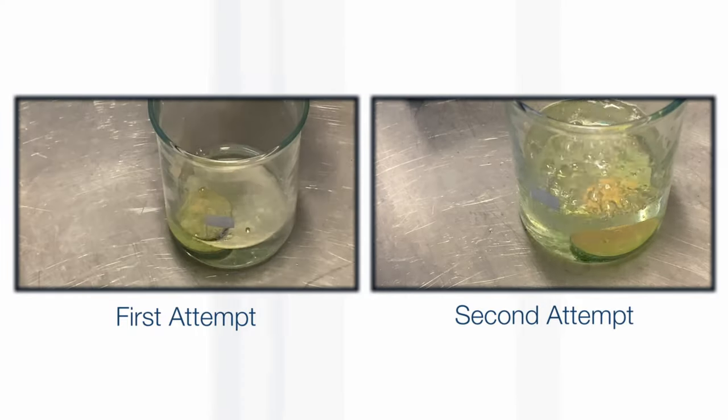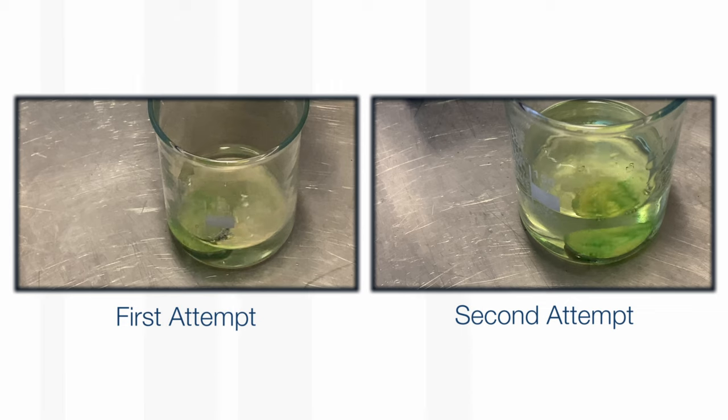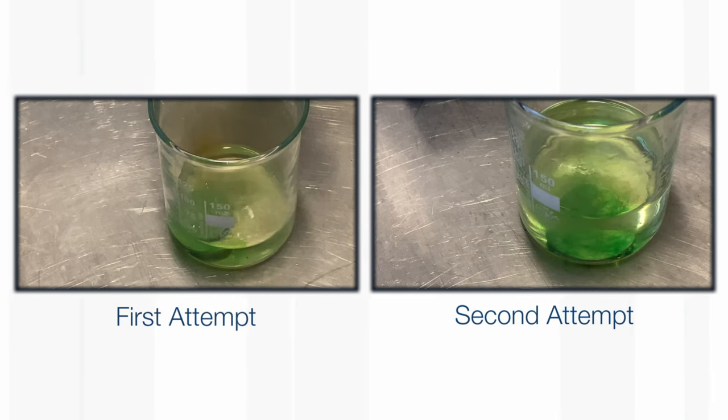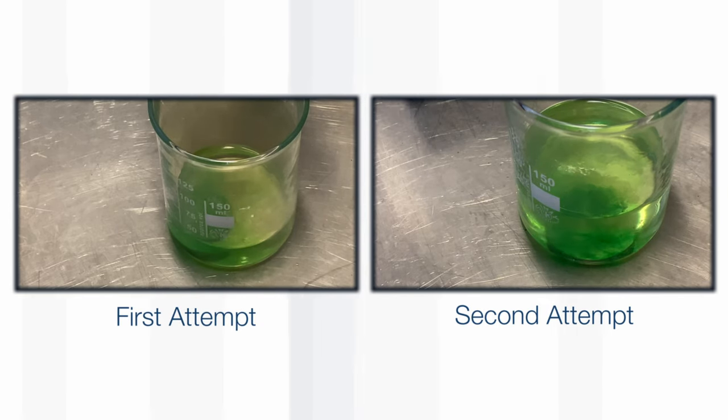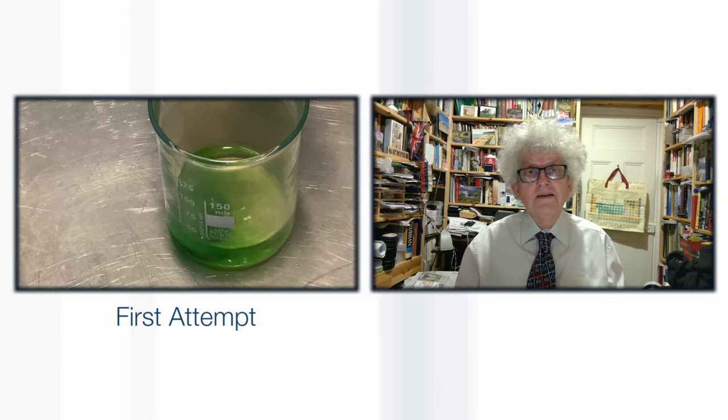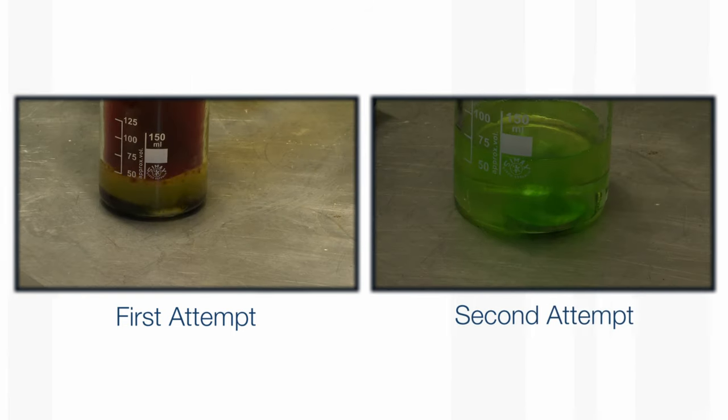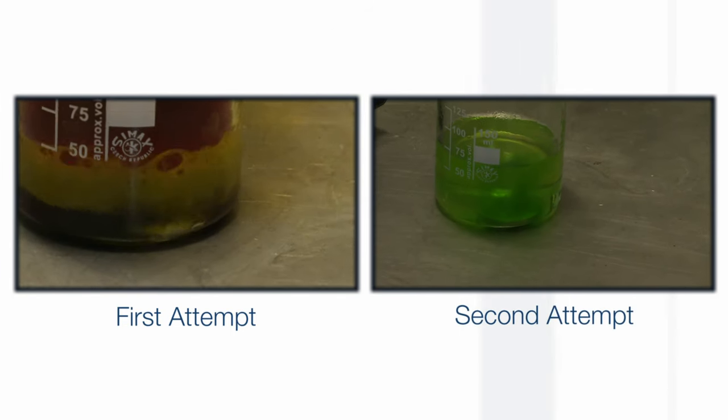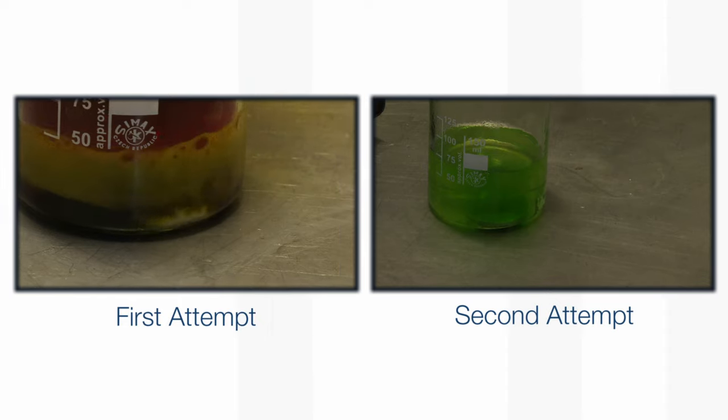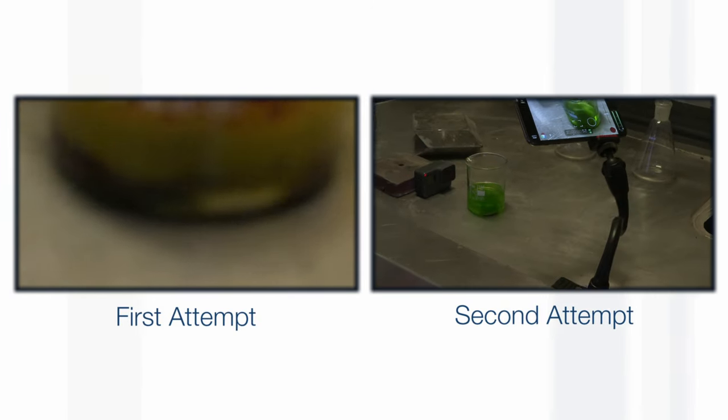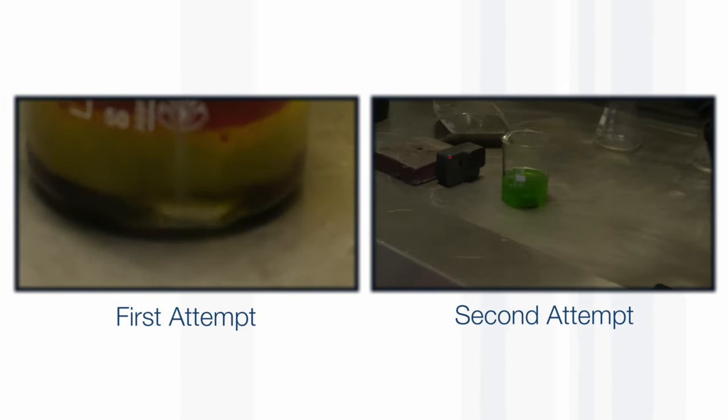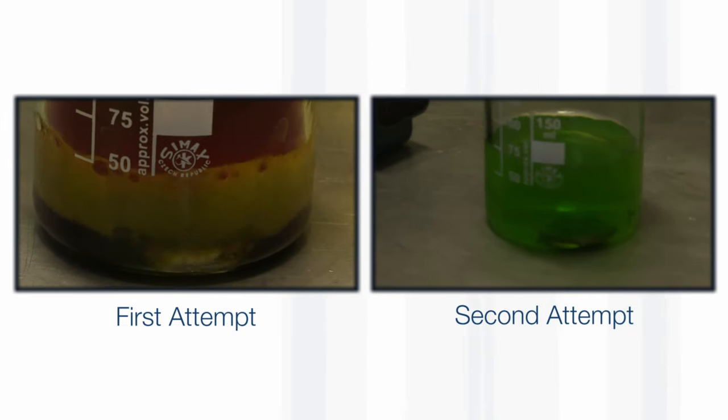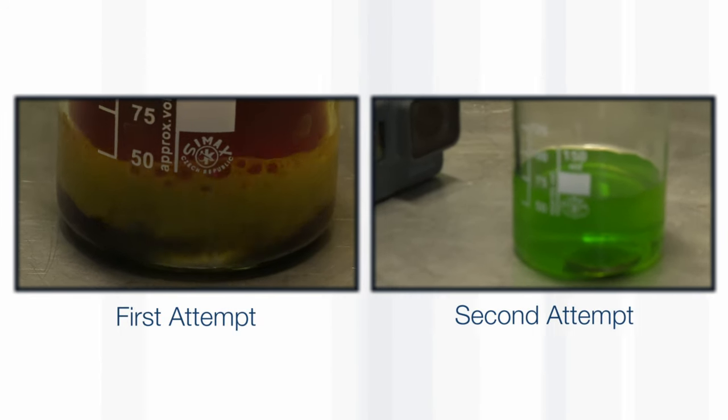Watching the video, I noticed that the volume of nitric acid in the first experiment was much smaller than in the second experiment. I decided that perhaps the solution had got hot, and the passivation reaction only happens with cold nitric acid. If you have very hot nitric acid, it can dissolve away the coating and keep reacting with the iron.